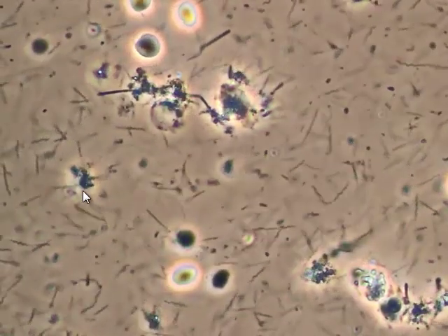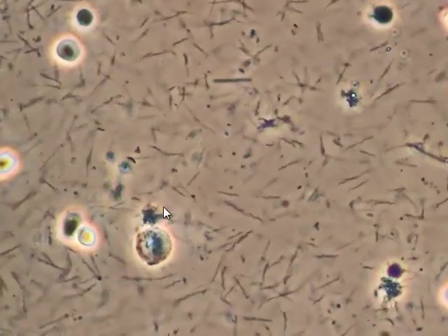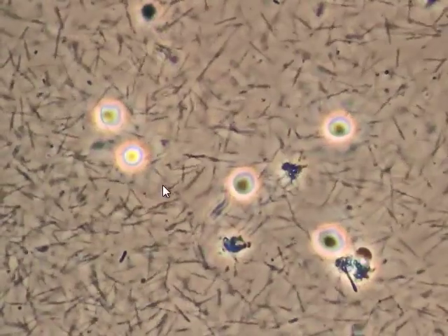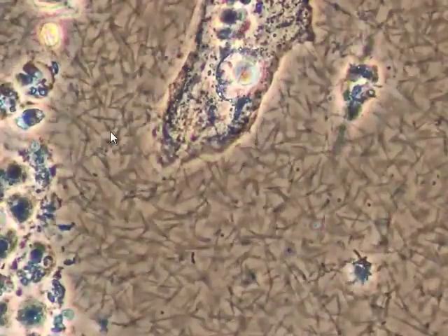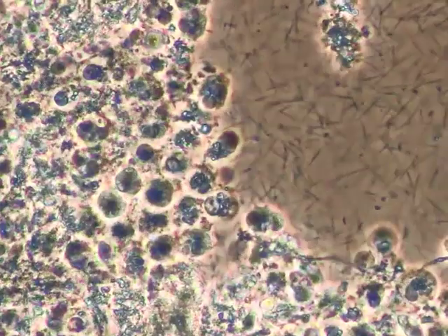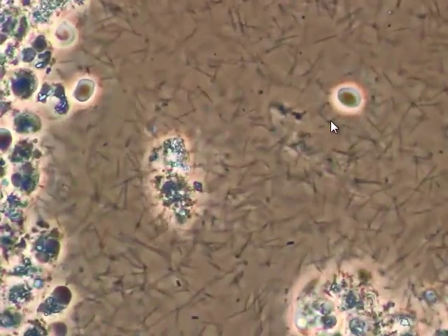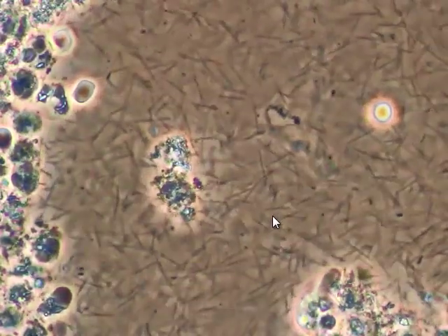This is a really good example of what happens in the plaque — how these bacteria feed on your cells. Here's a newer white blood cell, and here's one where it's being pretty well eaten: remnants of a white blood cell. These are all spirochetes through here along the edge. Here's a little organization of them around that one cell, moving around quite a bit. It shows you basically what's happening inside your mouth, and also inside your blood if the spirochetes are there as well.